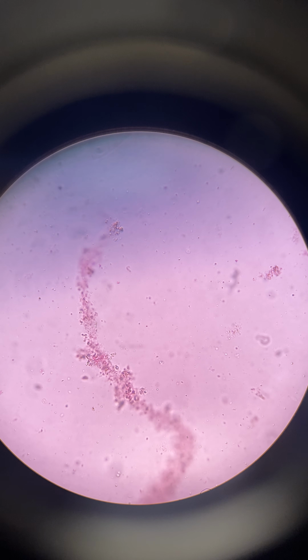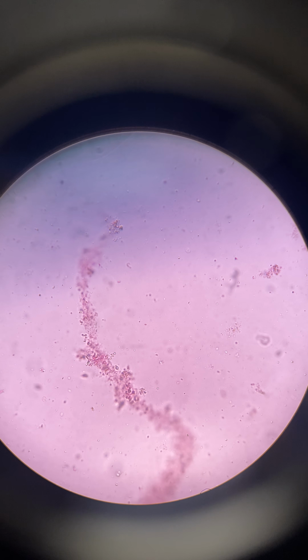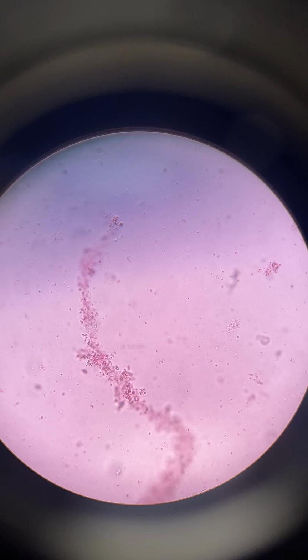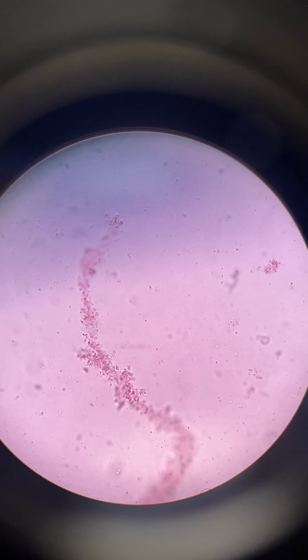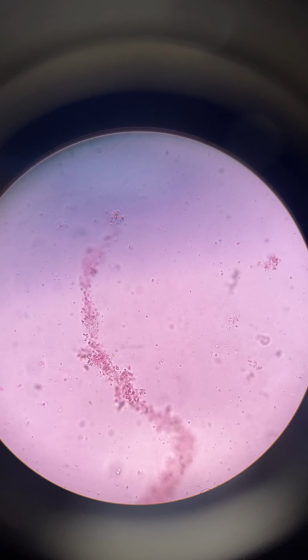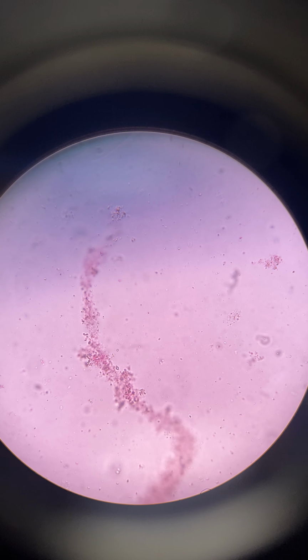Now you can see I'm actually doing it. So in the center of the slide here, I can see several of these little tiny particles, and now that they're not just whooshing upward anymore, you can see they're doing a kind of random dance. They're moving left, right, up, down. That is the Brownian motion.